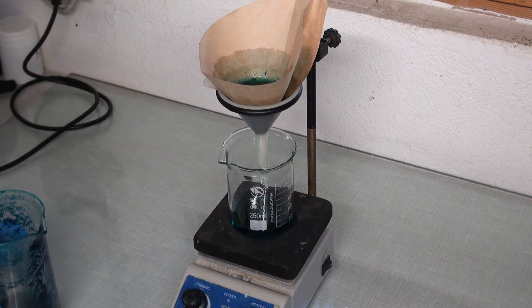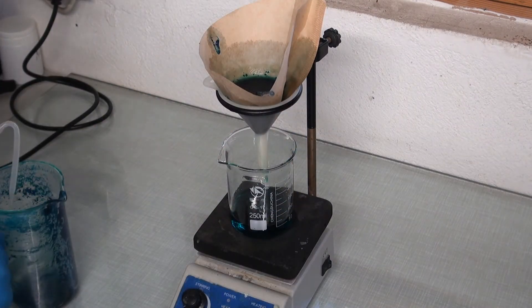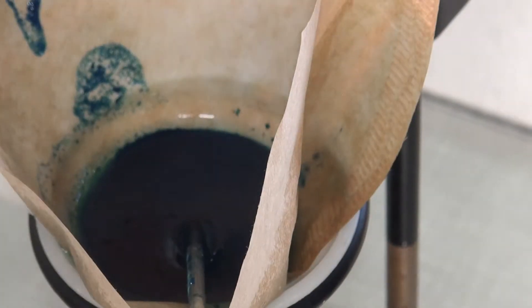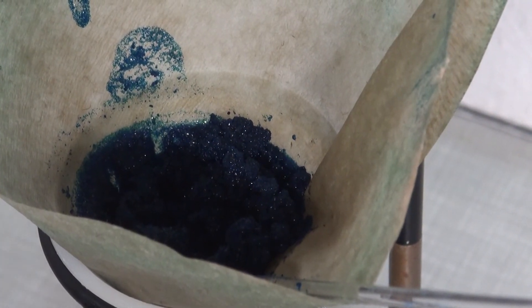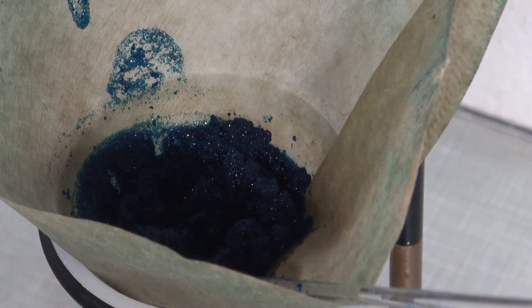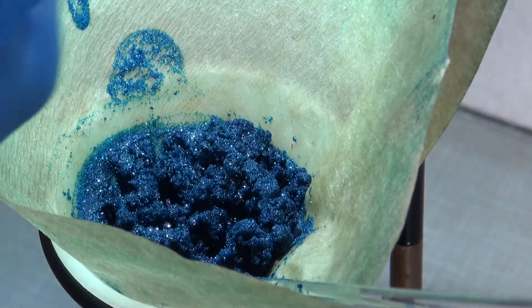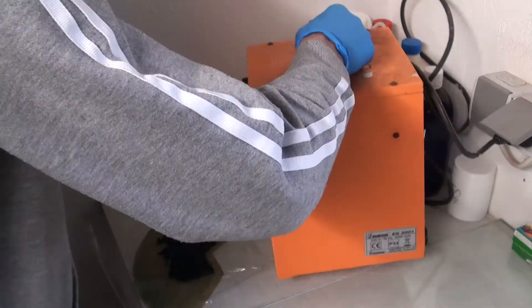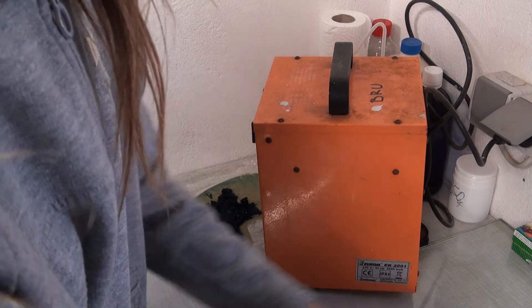The crystals were now filtered. They are small but extremely gorgeous. They don't show up that well on the camera, so I shone some light on them for you to see. To dry them I used my fast drying setup — it is simply a hot air fan.